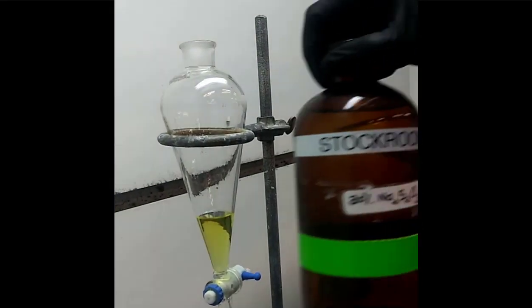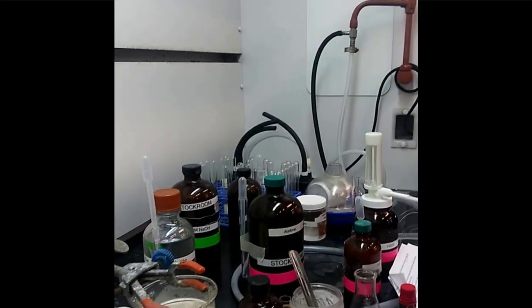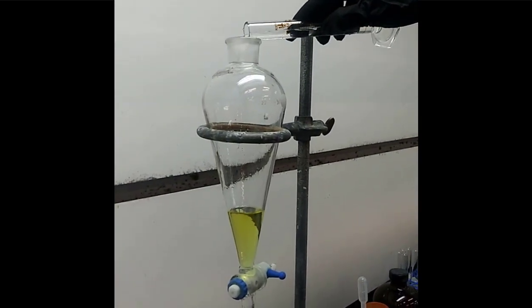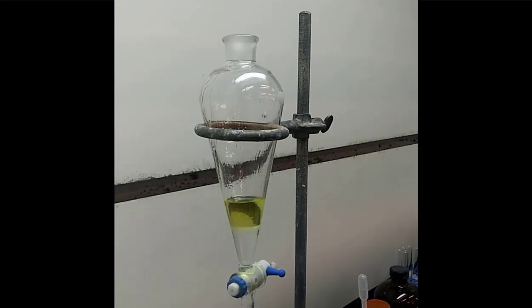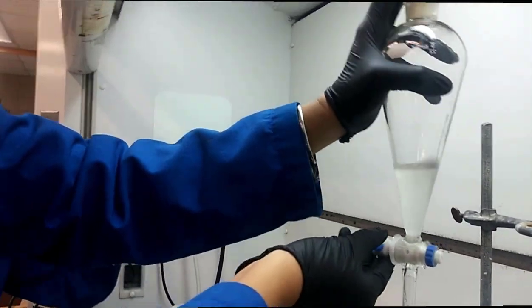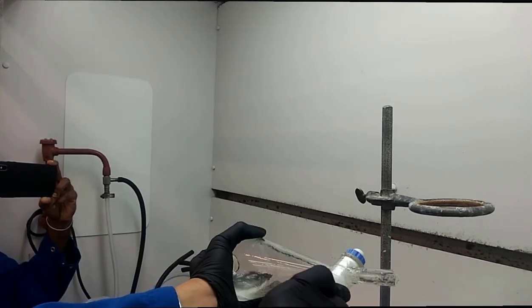All right, so anyway, they removed the aqueous layer, and so now all they have is the yellow-ish organic layer that's got the alcohol in it. And now they're adding 7 milliliters of 30% sodium thiosulfate. All right, and so what you'll see is a lot of the yellow color will leave. And so with this sodium thiosulfate, you're going to see. Now remember, in the reaction we did. Ooh, look at that, so pretty.